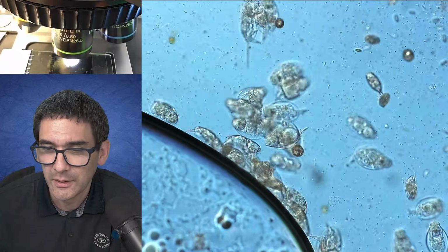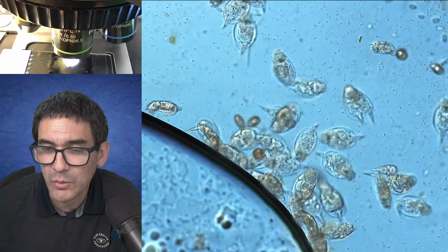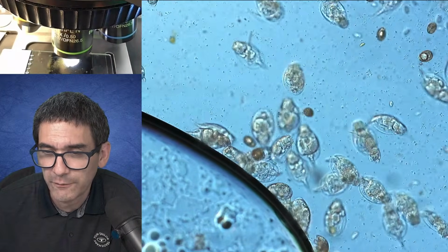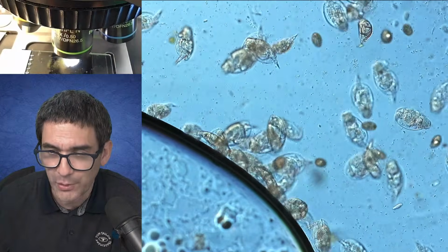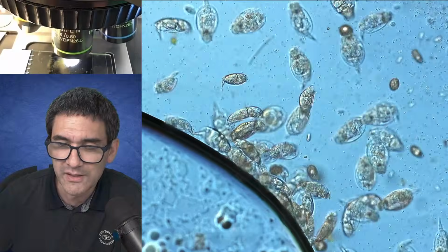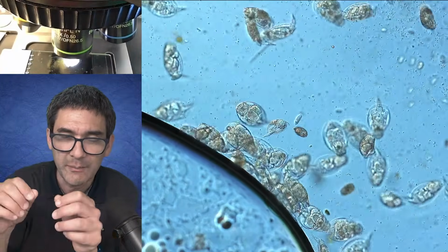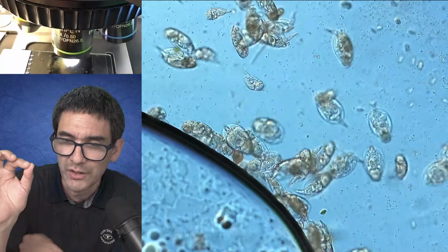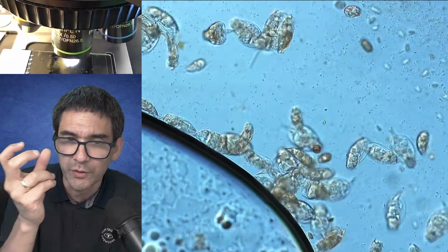You can't center the condenser. May I say the following? With a Swift 380T, it is possible to center the condenser. If it's a little bit off center, it's not something that you can do dynamically. There are 3 screws that you can loosen at the condenser, and then you can move it around a little bit.